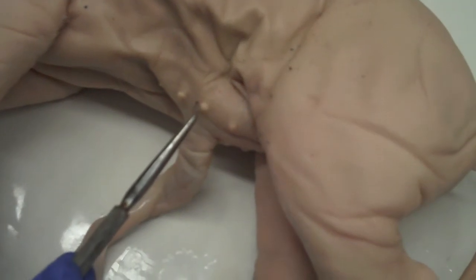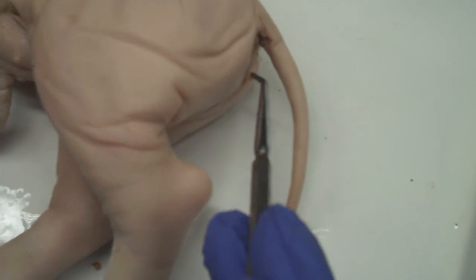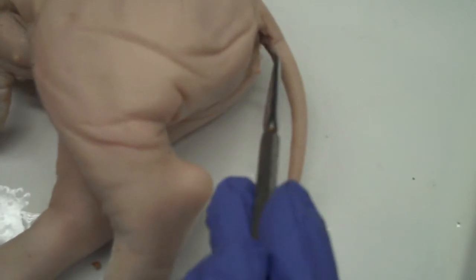Then we have the knee, the ankle, the mammary papilla. Then moving caudally, we have the genital papilla and the anus.